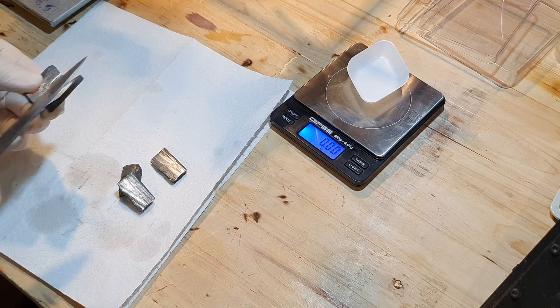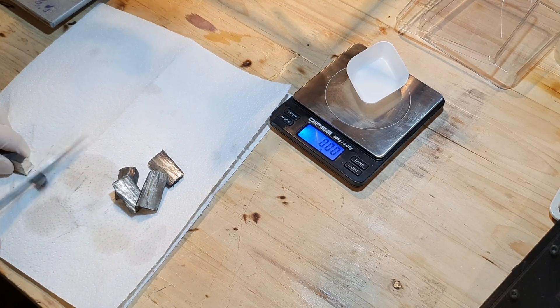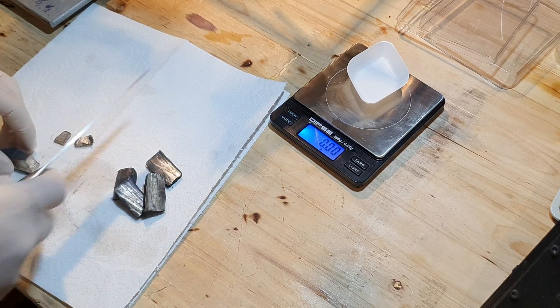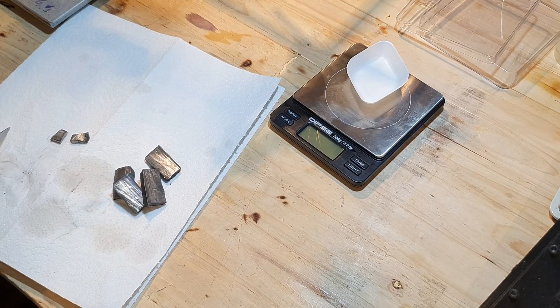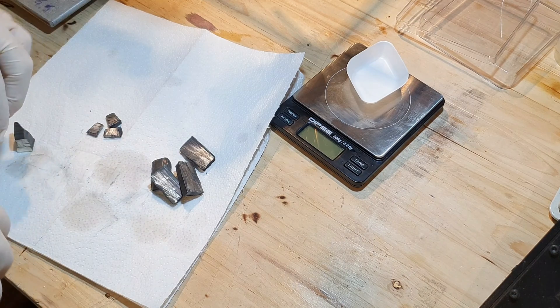The second reason for this video is that I'm trying to increase the yield. My yield has never been better than 50%, so let's see if we can squeeze a little bit more out of this synthesis. All of the cesium produced in this video will be used for my collaboration with Elias from Elias Experiments. If you have ideas for reactions involving cesium that you always wanted to see, write me a comment and we will try to make it happen.